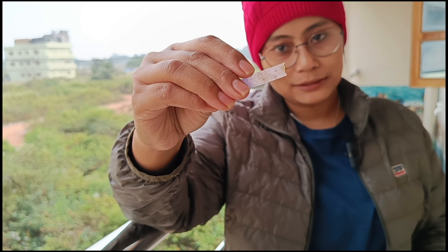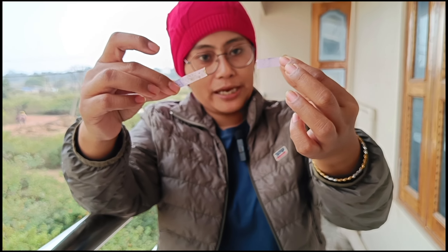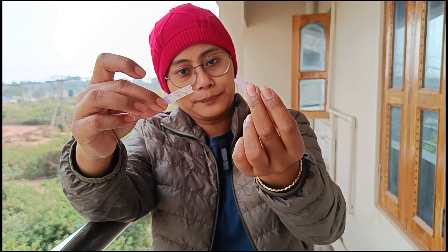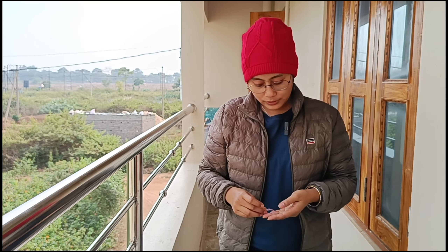The litmus paper turns bluish-black in color, as compared to the one tested before which doesn't show that blue-black color. This is how you detect the presence of phenolic compounds very easily.